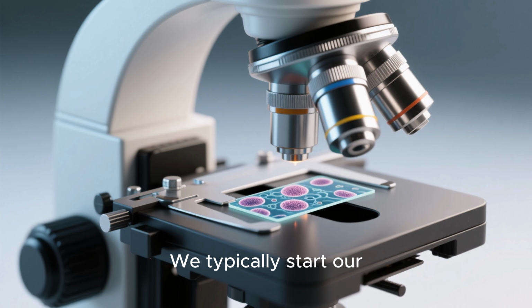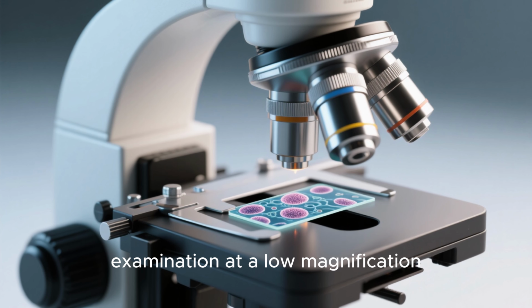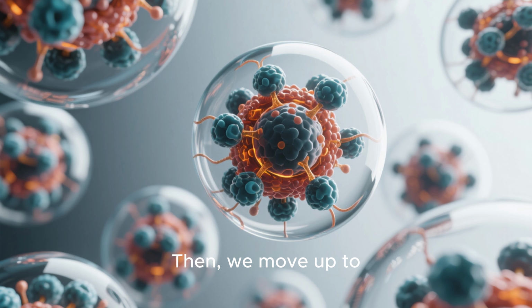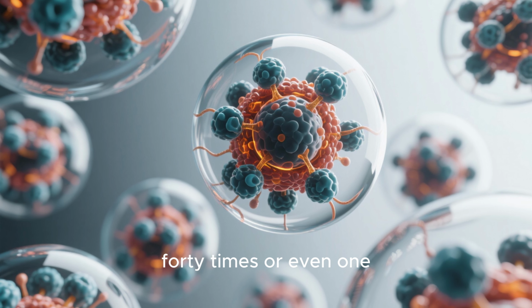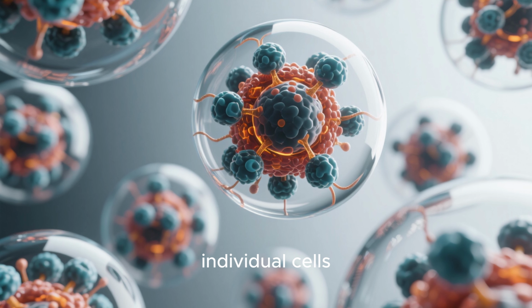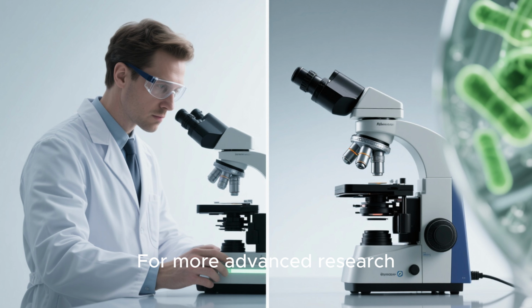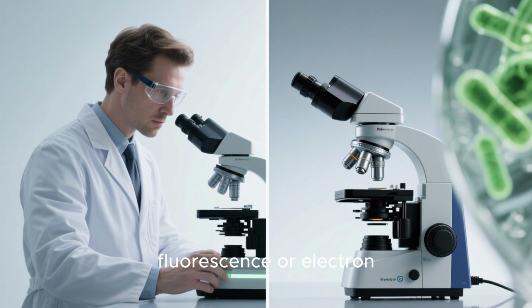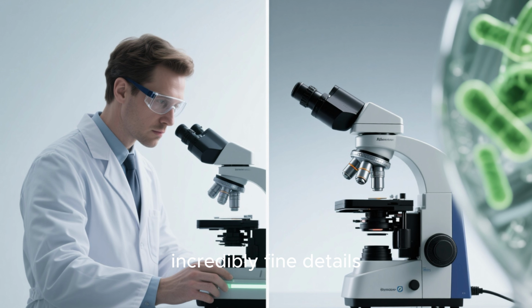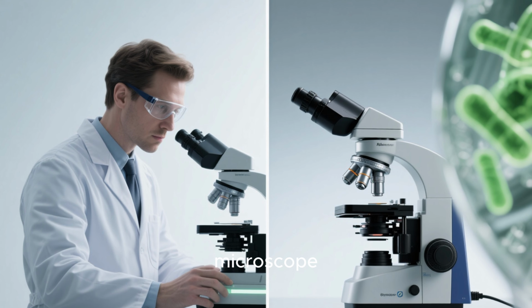We typically start our examination at a low magnification, like 10 times, to get an overview of the slide. Then, we move up to 40 times, or even 100 times, using immersion oil for a closer look at individual cells. For more advanced research, scientists might even use fluorescence or electron microscopy to see incredibly fine details that are invisible under a standard light microscope.